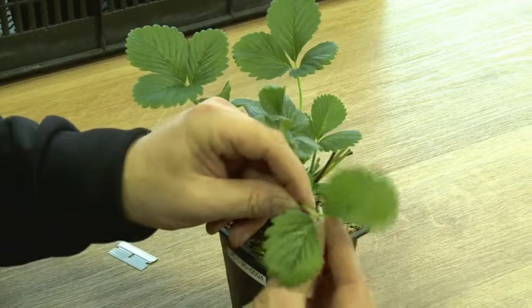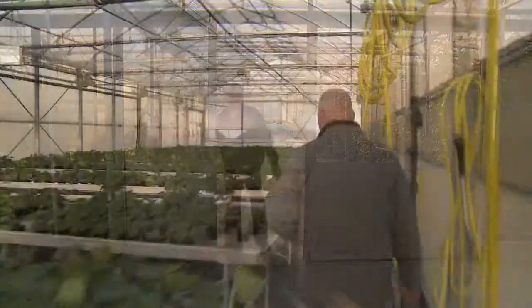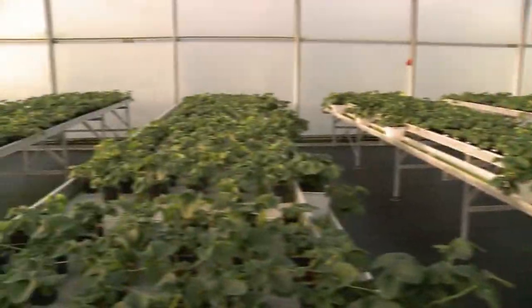Bioassays for soft fruits such as strawberry and raspberry are carried out on test plants from the same family. After leaves have been grafted onto test plants, the symptoms become visible after 2 to 8 weeks, depending on the virus species.